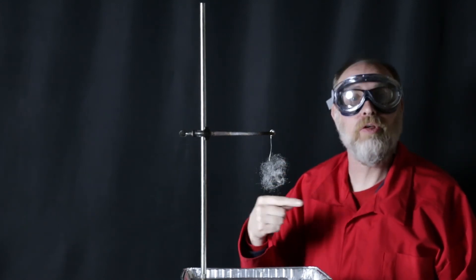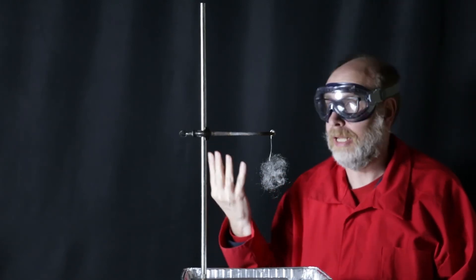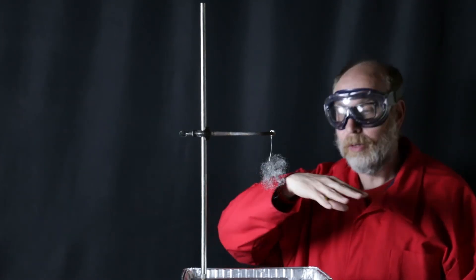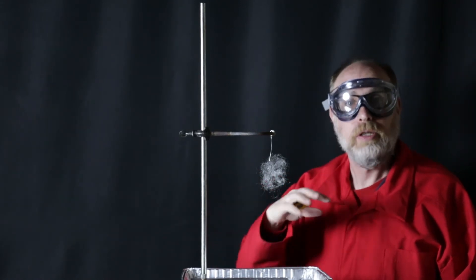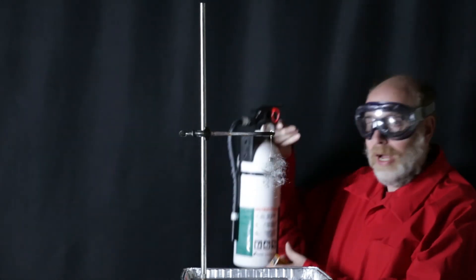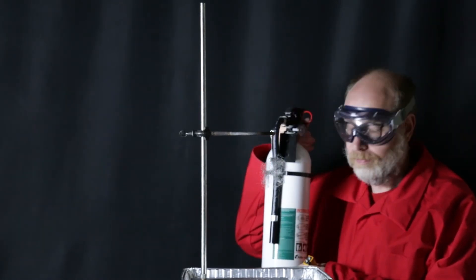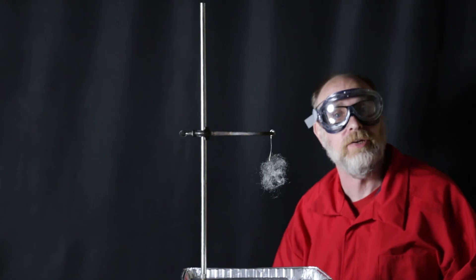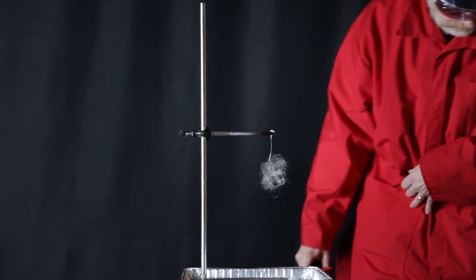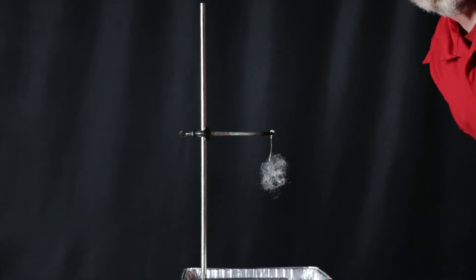Now, again, another one of those reactions that you probably shouldn't be doing on your own in your backyard or in your basement like I'm doing right here. I've done this a bunch of times. I actually have aluminum foil or aluminum trays all over so that any sparks or anything will be caught by the aluminum tray. But just in case I do have my fire extinguisher here that I could get out and use if I need to. I won't because I'm taking safety precautions, but it's good to have it. So I'm going to move out from behind the table.